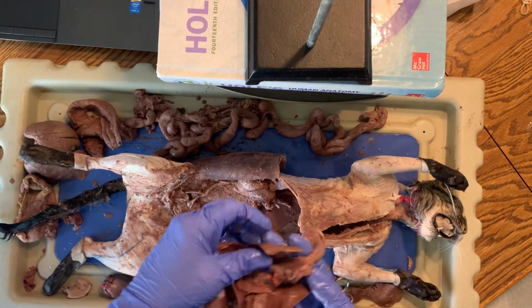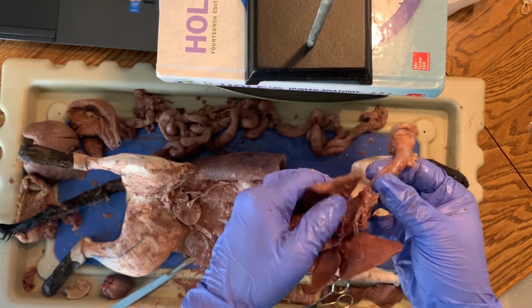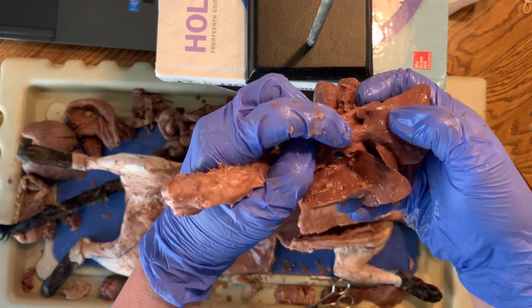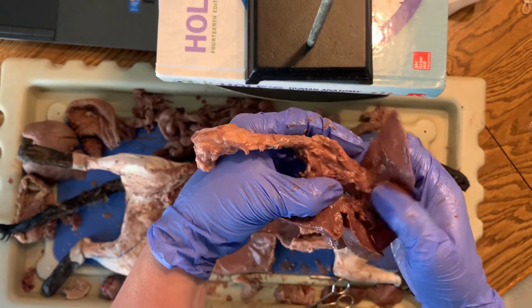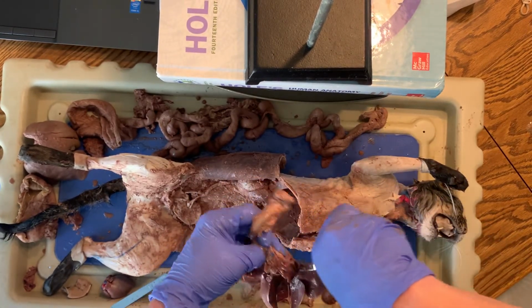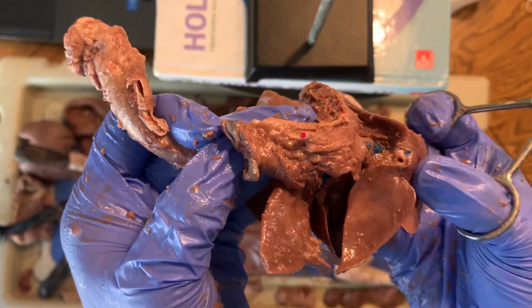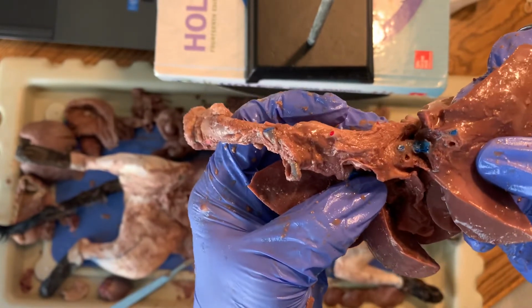And if I try to go back to the lungs here, where the trachea first tries to branch into the lungs, right there in the very first division, that would be a left and right primary bronchi. And then as it gets smaller and smaller, they would go into bronchioles. But can you see that hole right there where if I squeeze, liquid's coming out? That's one of those bronchi openings.